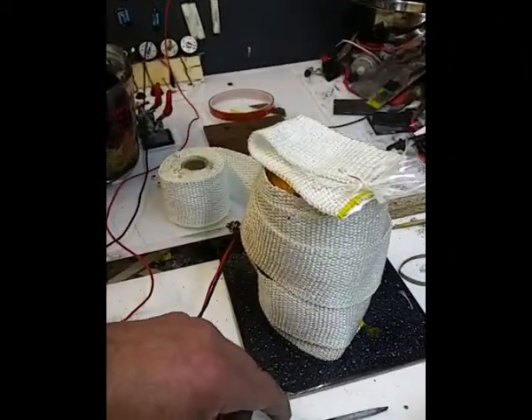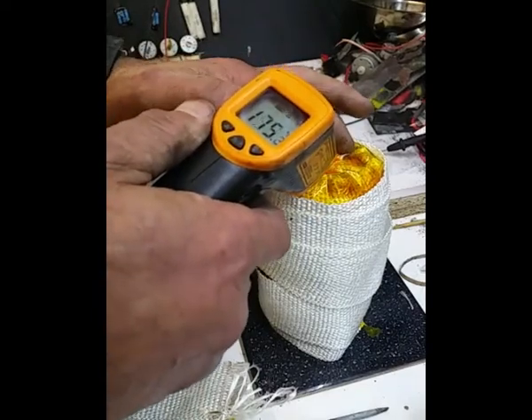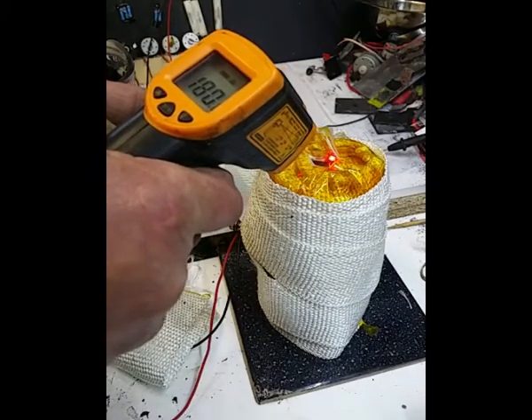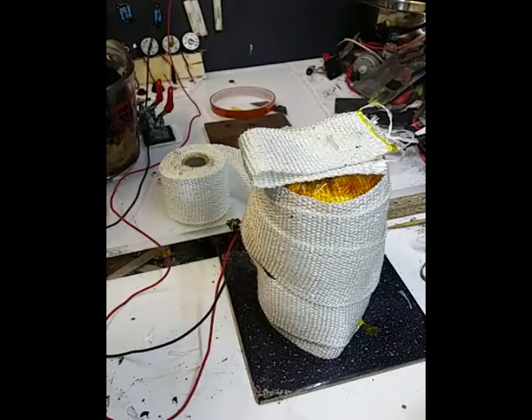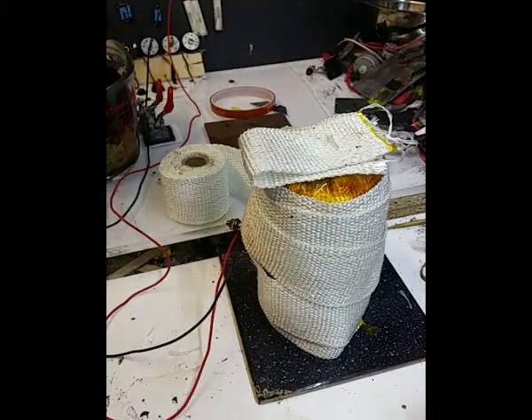I'll just check that temperature, see where we are, and it's 175. Okay, so we've got fairly good temperature there. So I think from one point of view it's quite successful, so I'll leave it at that. And you know, there is a lot of, well, not a lot of steam, but there is steam coming out of it, so there's no point in carrying on with that.